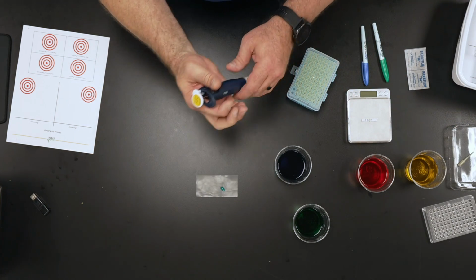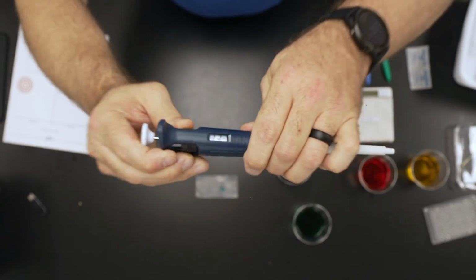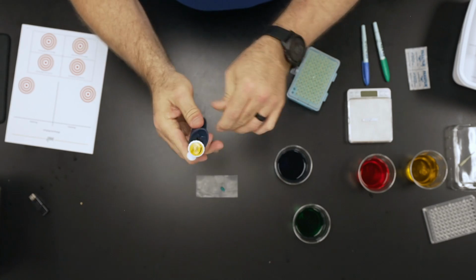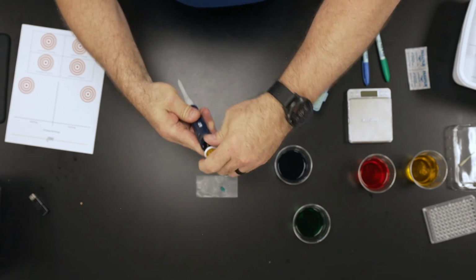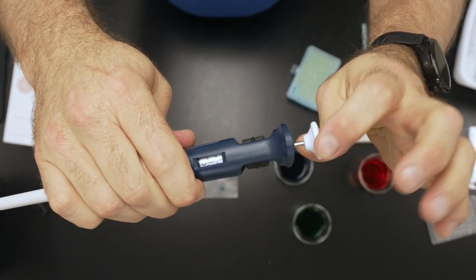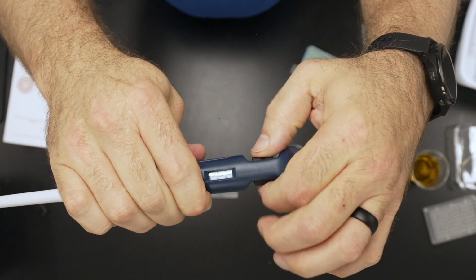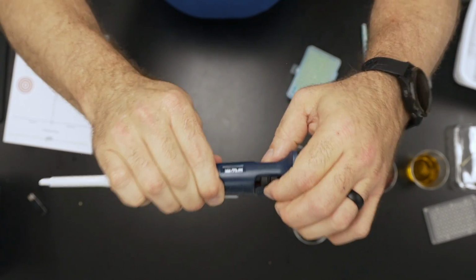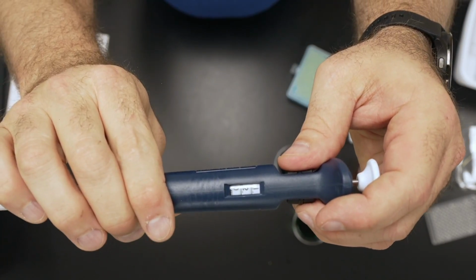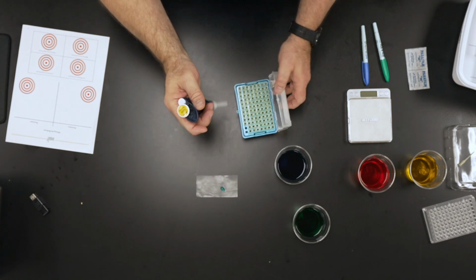Now what I'm going to do is change my volume from 60 to 120, okay? And to turn it the correct way, I'm going to turn this to 120. And I'm not sure if you're seeing as I'm turning this. There's two ways of doing this. You can turn this dial, or you can actually turn this bulb right here. It's open both ways, whichever is easier for you to do, okay? I just went past 120, so I now have it at 120. 60 and 60, 120. Let's get a new tip and let's see if this works.